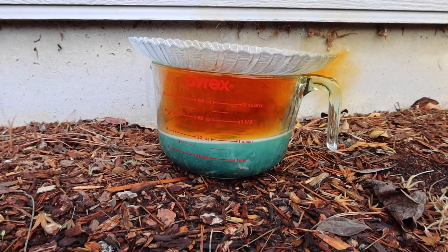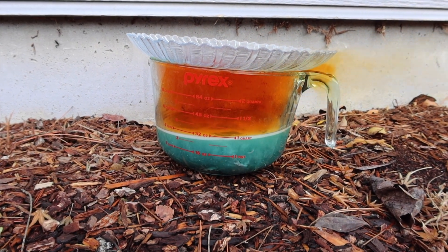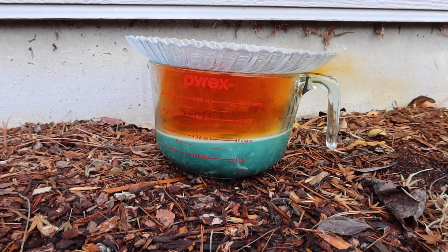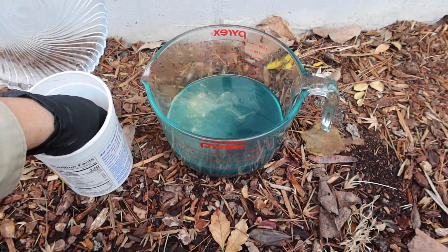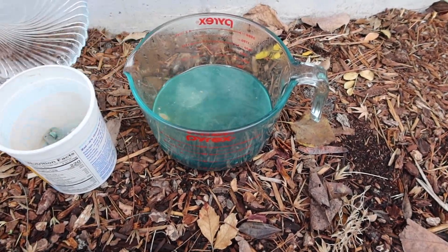It's good to cover the glass with a lid. When the nitric oxide gas comes into contact with water it turns back into nitric acid. It's important not to add all the silver and nitric acid right away because the reaction can get violent and boil out of the container.